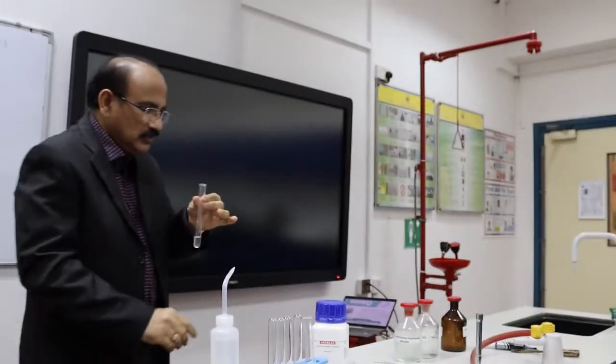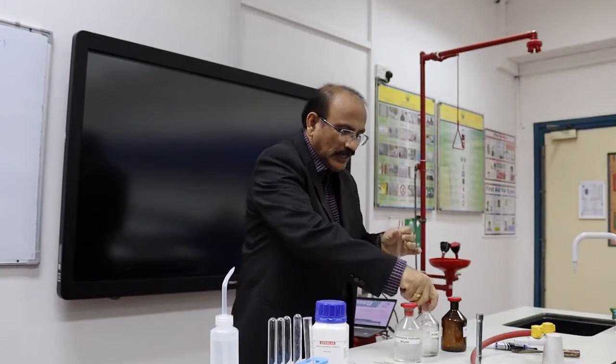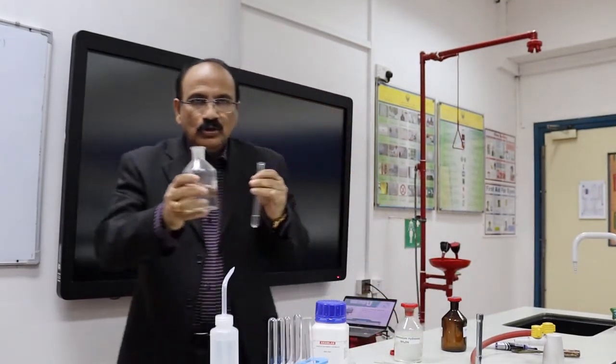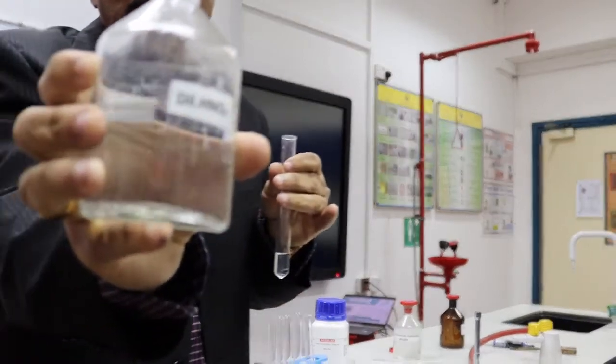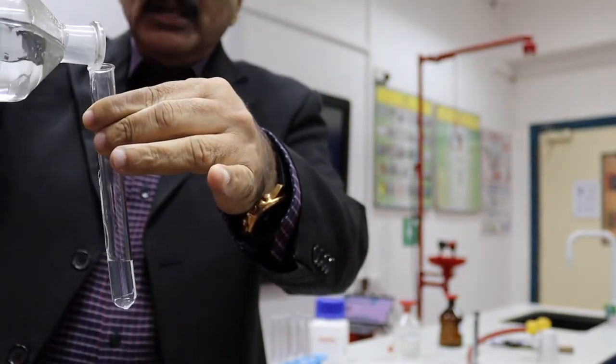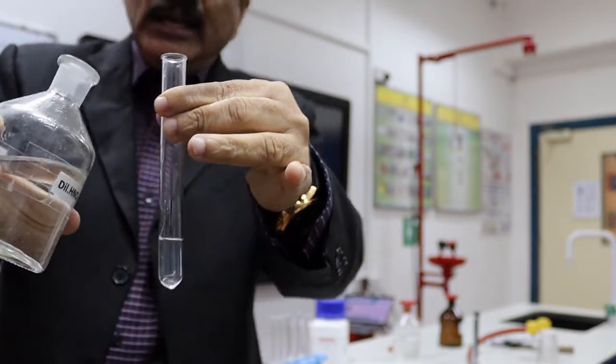Into that we will add dilute nitric acid. See, it is dilute nitric acid. So I am adding dilute nitric acid. It is just for bringing that into the acid medium. Dilute nitric acid.